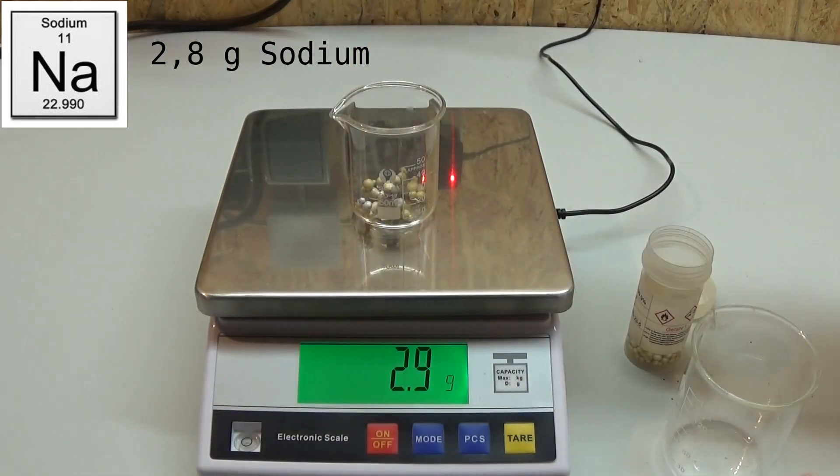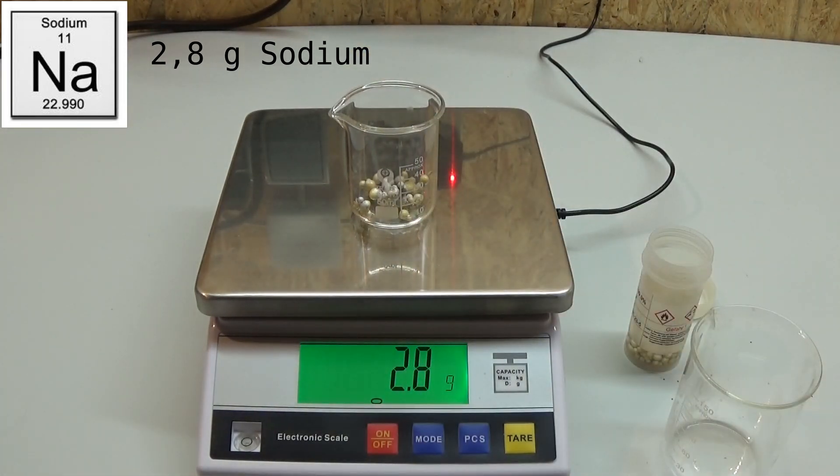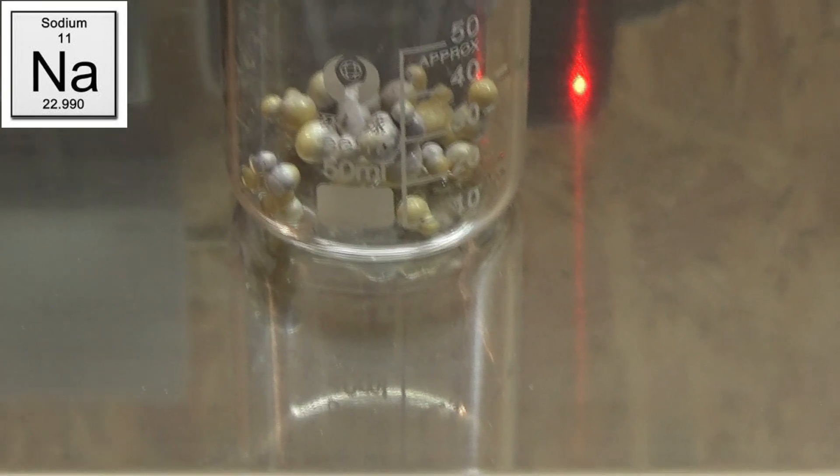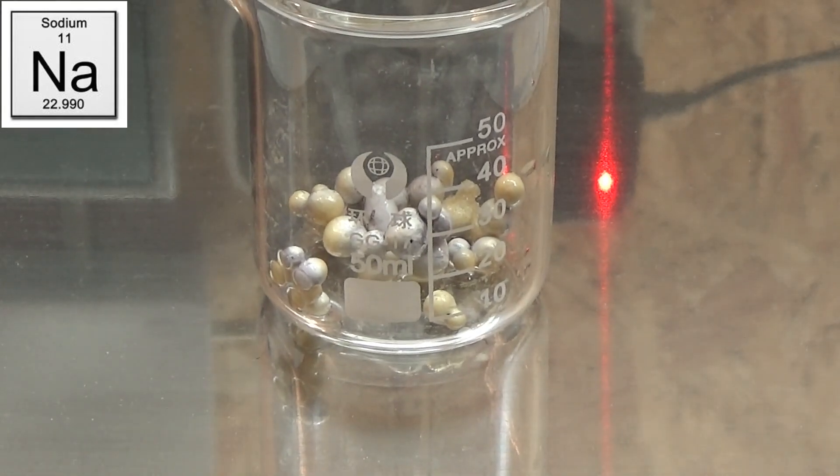In our case we will use 2.8 grams of sodium that yields the catalyst. Make sure that the sodium you use is free of the storing liquid because I did not clean it enough which ultimately ended up producing a white foam in the later reaction.